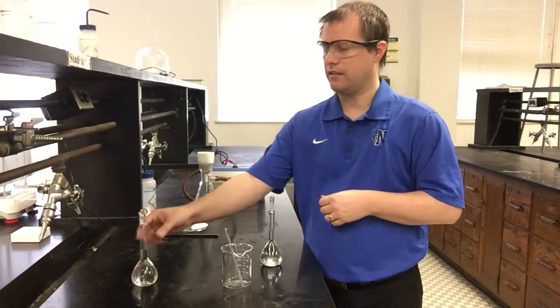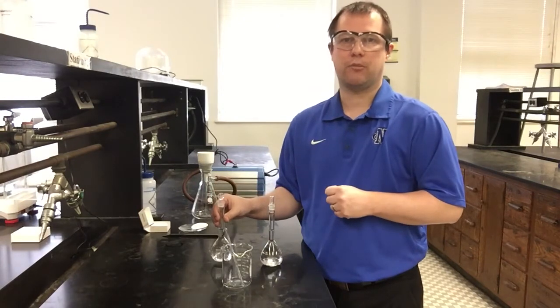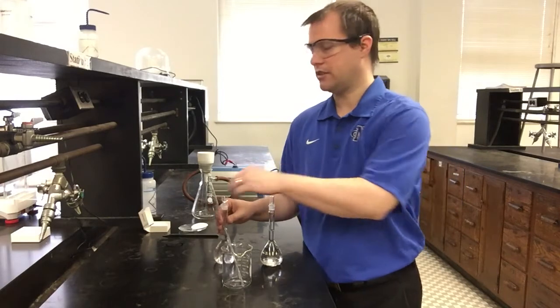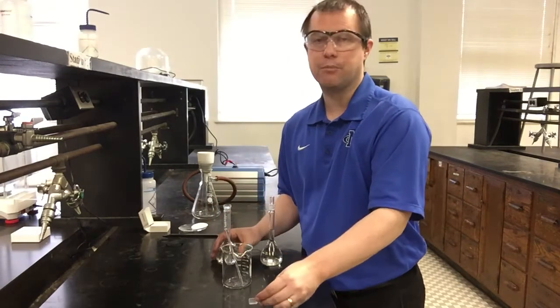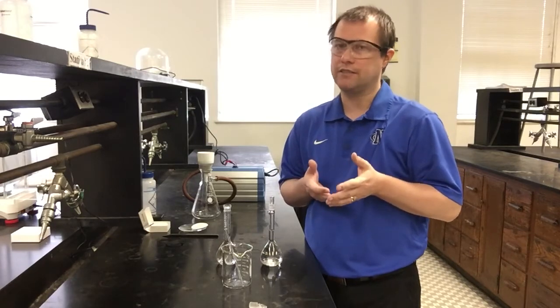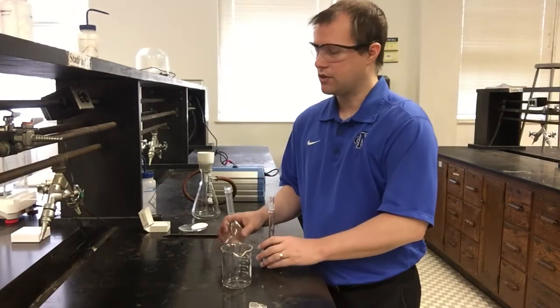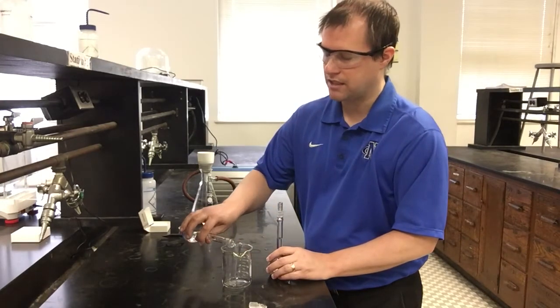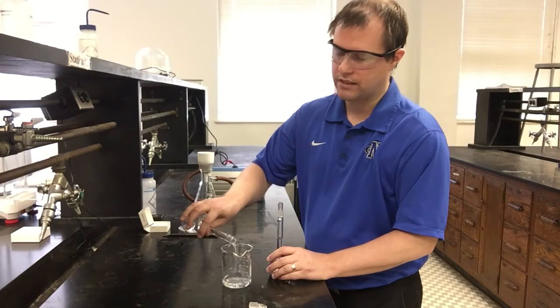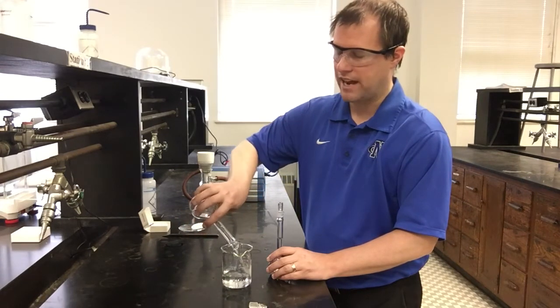I could take, and you see I have a label, I could have my calcium chloride and add all of it first, and then I'll add all of the sodium carbonate, or vice versa, or I could just pour them in together. It isn't really going to make much of a difference in terms of making the precipitation reaction work. Most precipitation reactions work very effectively. It's not very difficult to get the reaction to occur. So the order of how we mix things is not all that important. So I'm going to go ahead and add all of my calcium chloride in this case first. But again, that order is not very important to the actual reaction itself.